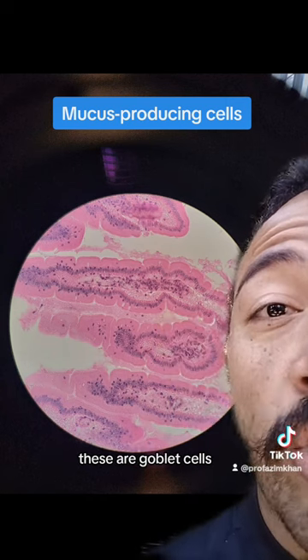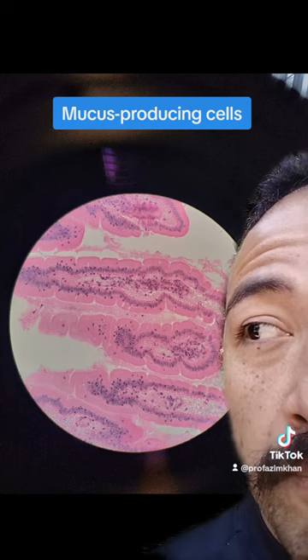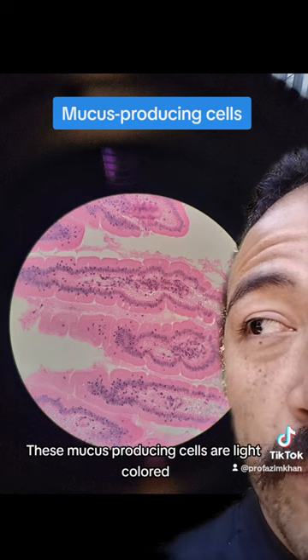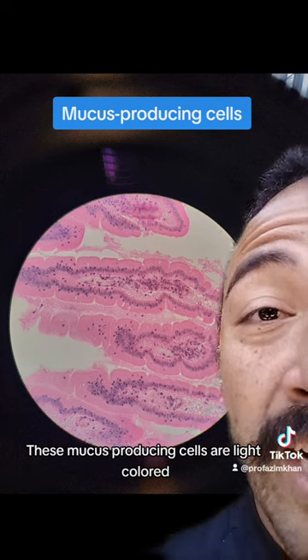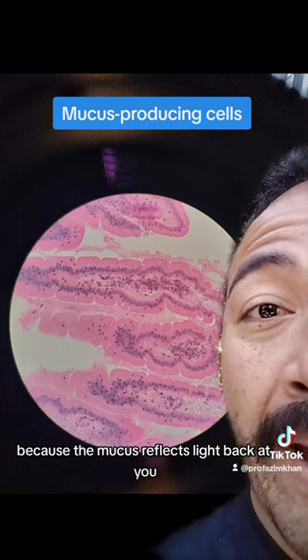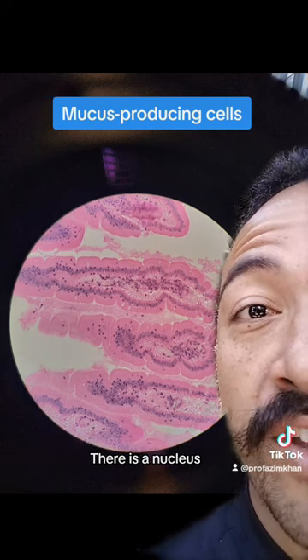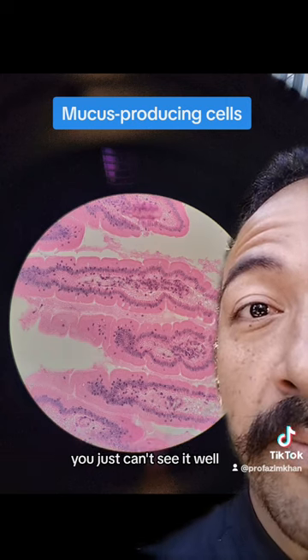these are goblet cells. These mucus-producing cells are light-colored because the mucus reflects light back at you. There is a nucleus — you just can't see it well.